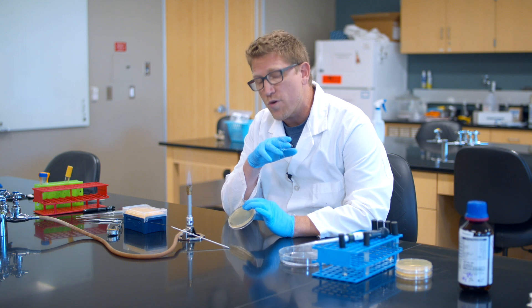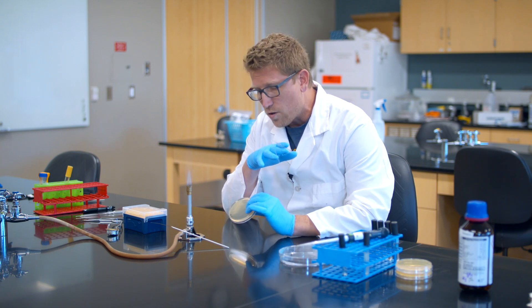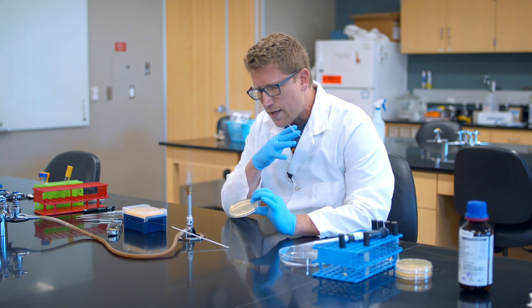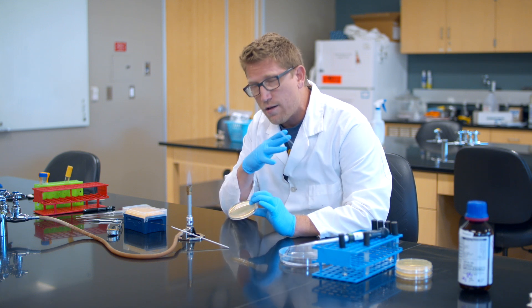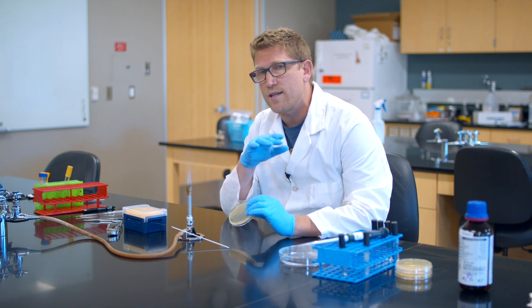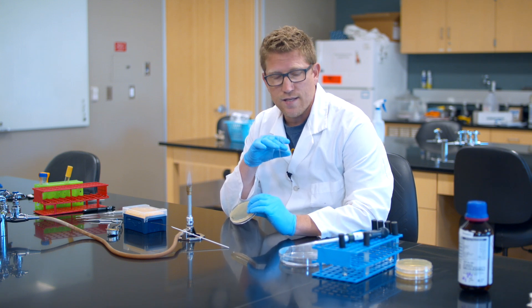However, if this had been diluted out, we might get individual colonies. But our goal is not the same pattern that you would get from a streak plate. Our goal is to get the bacteria to grow all the way across the surface. And we can use these spread plates for a variety of techniques that you'll be learning about in subsequent videos.